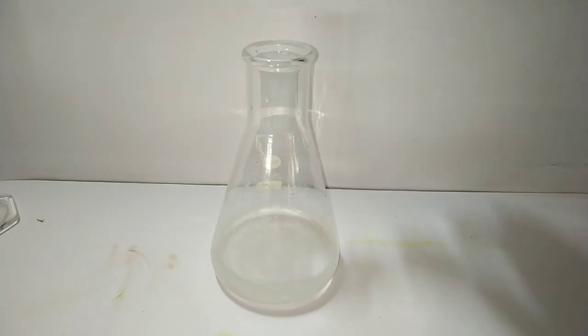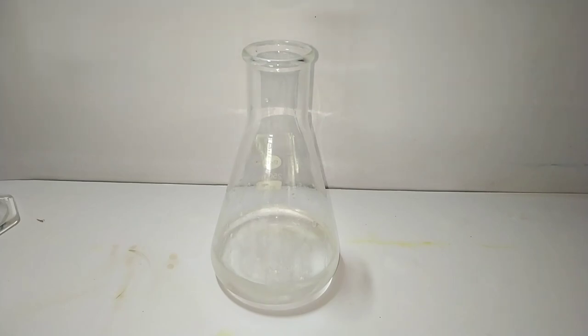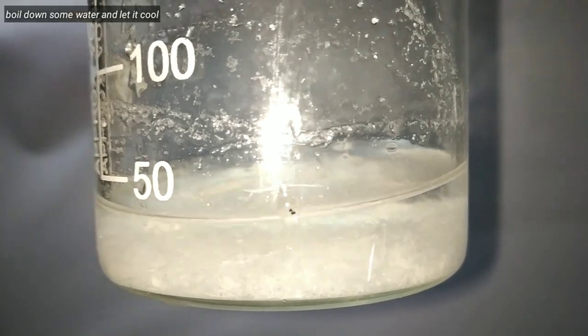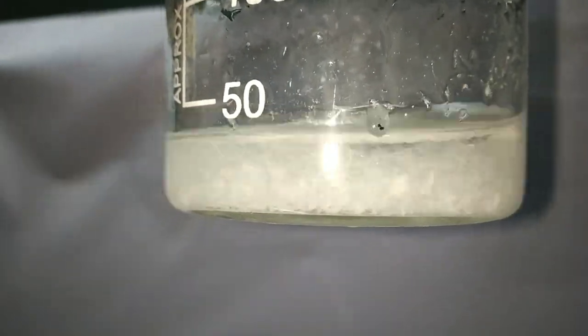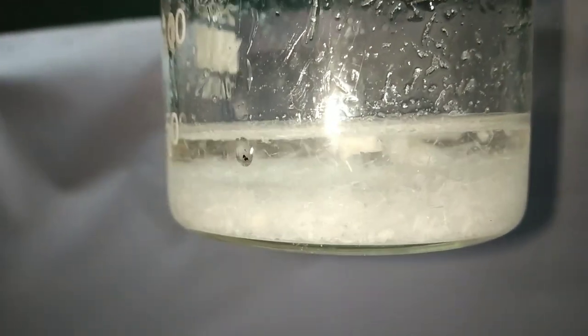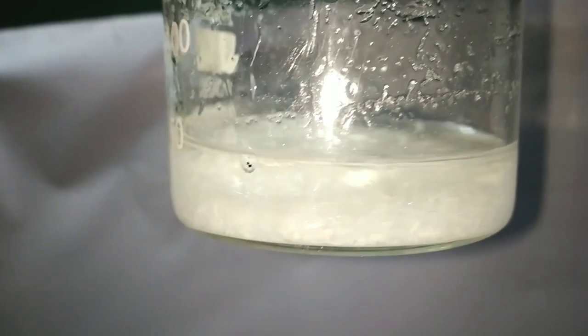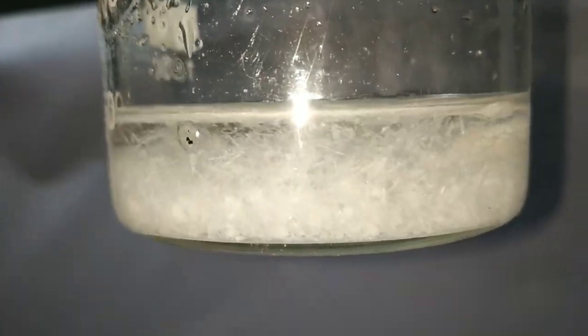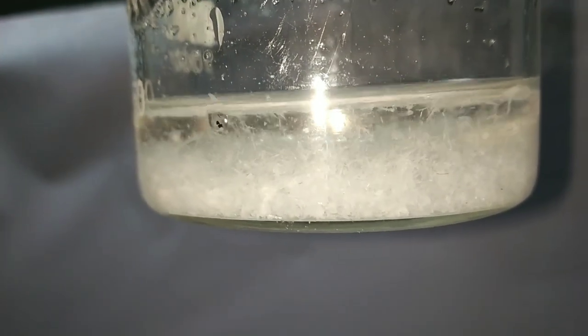Then we mix these compounds well. After that we keep the flask undisturbed. Theoretically I should have obtained crystals, but in my case I didn't, so I had to boil down some amount of water. On cooling, I obtained these needle-shaped crystals of cyclohexanone oxime.